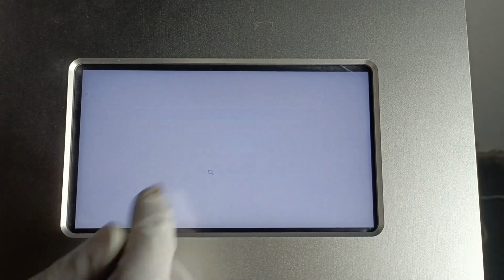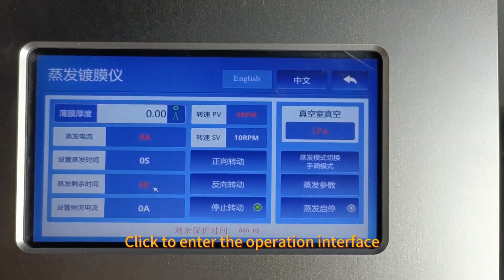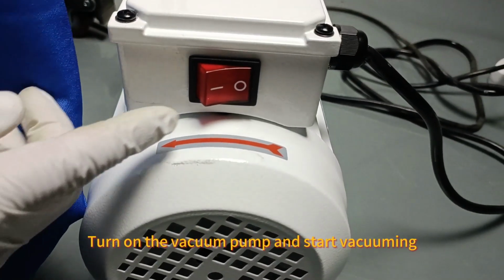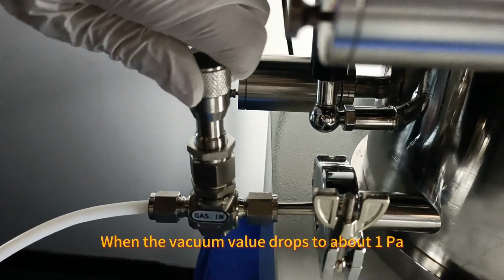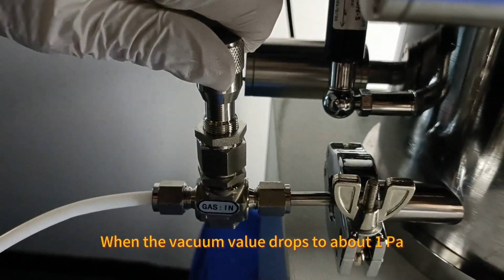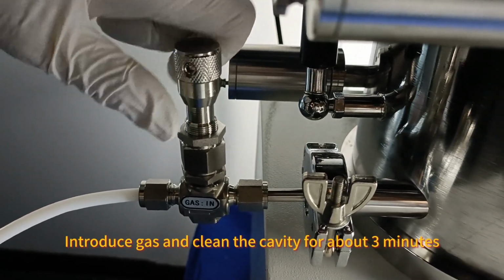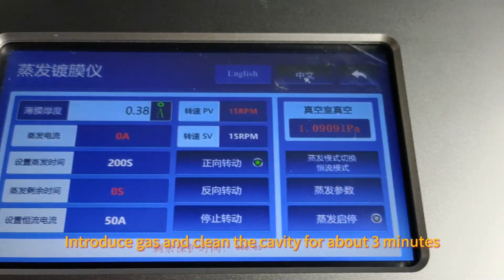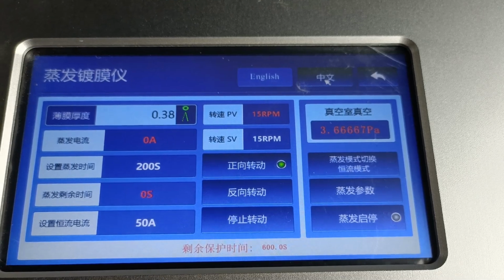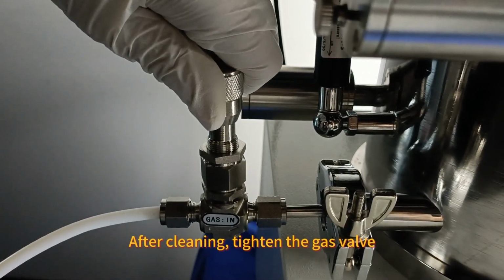Click Ignore. Click to enter the operation interface. Turn on the vacuum pump and start vacuuming. When the vacuum value drops to a certain level, open the gas valve. Introduce gas and clean the cavity for about 3 minutes. After cleaning, tighten the gas valve.